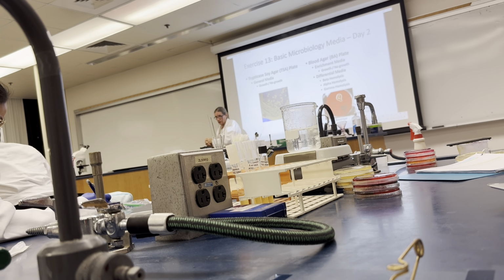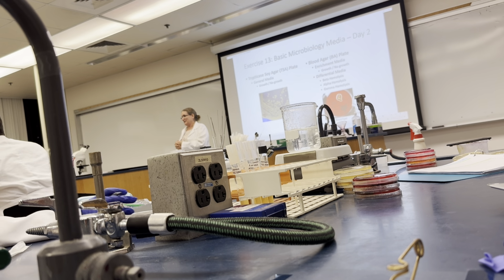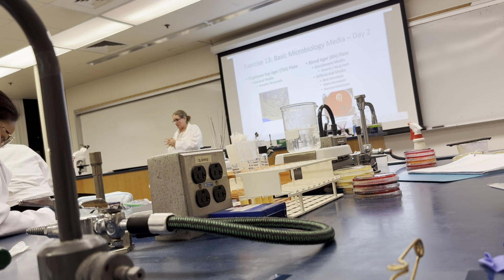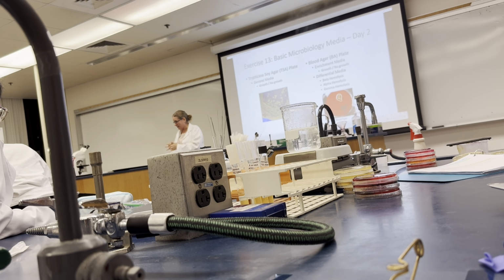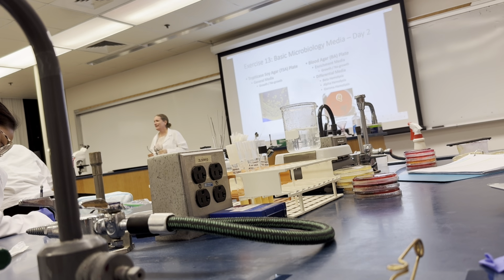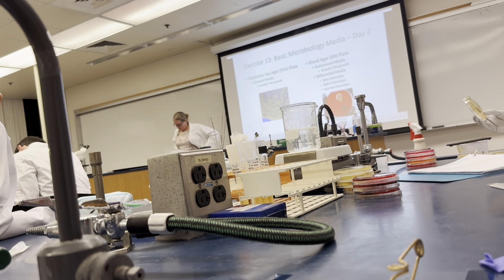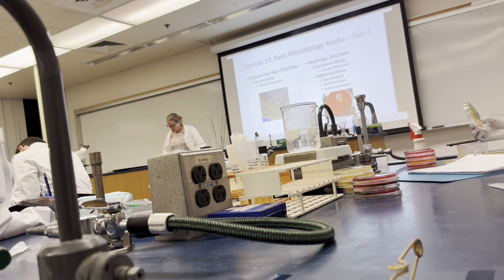right? Everyone agree? Of course you did, because I just told you, I'm the teacher, and you're like, yes, you're right. No, I'm not always right. Sometimes I am. You better agree. I got my Salmonella as an alpha, because it looks green as a pond. Could that be a mistake?